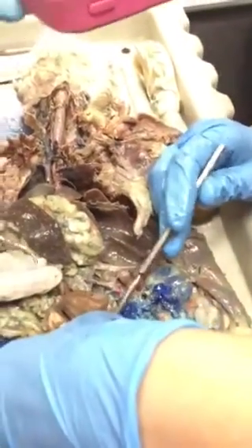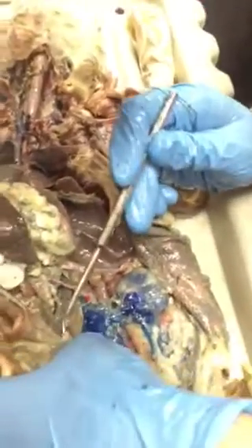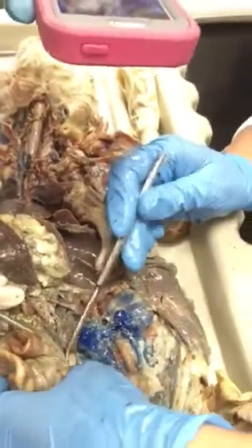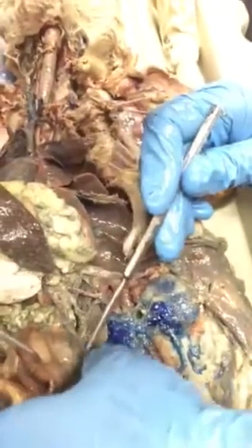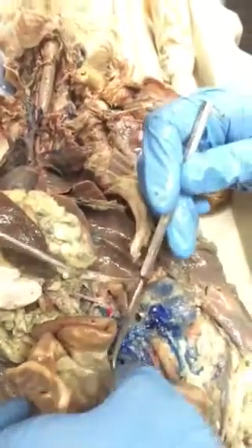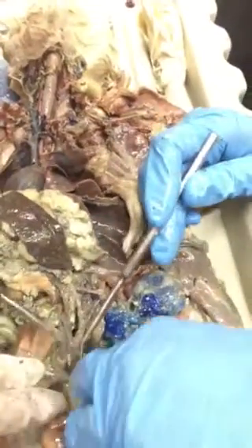Is that what that is? There's all kinds of fatty stuff in here, but see, this looks like an adrenal gland. Oh, I never would have known that. It's very weird in the cat. They didn't sit right on top of the kidneys. I knew you said they were medial, but we moved everything around in there so much. That's what that is, I think.